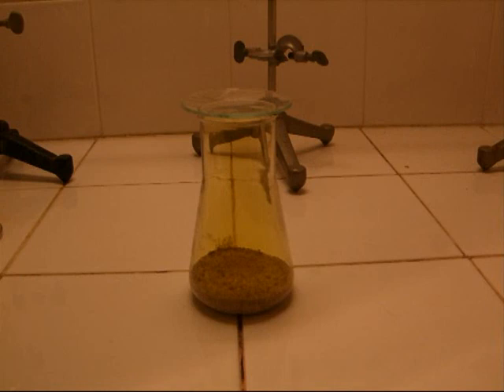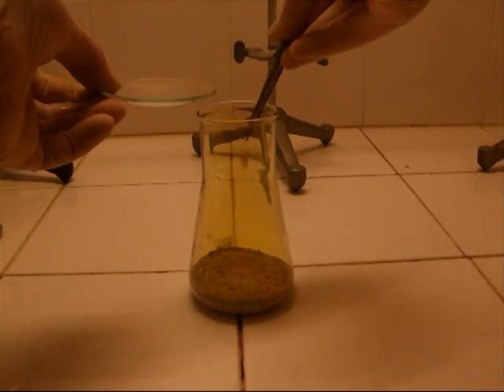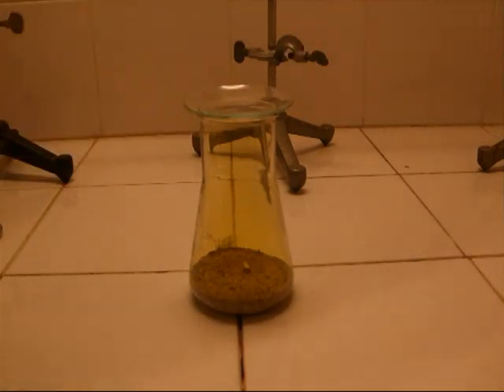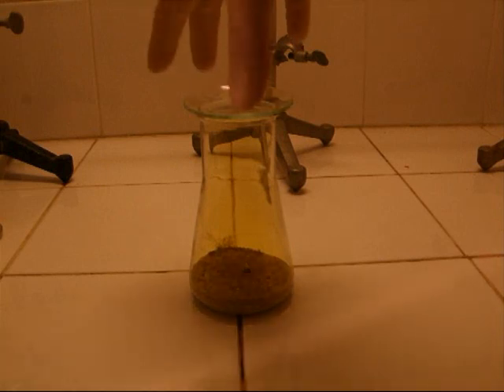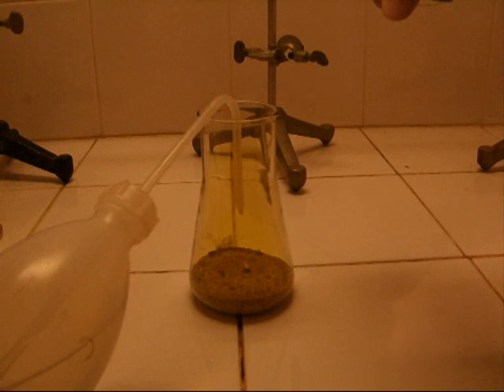Now, last but not least, the reaction of sodium with chlorine. Again, the same preconditions, but the bottom of the Erlenmeyer flask is covered with some sand. This protects the glass from the heat of the following reaction. A small piece of sodium is positioned in the chlorine atmosphere. As you can see, there is no reaction yet, but by adding a little bit of water, the reaction starts.